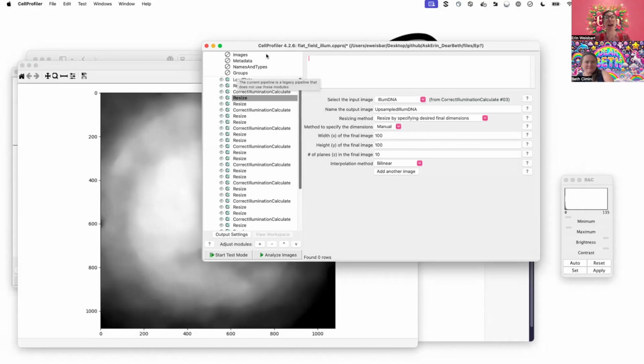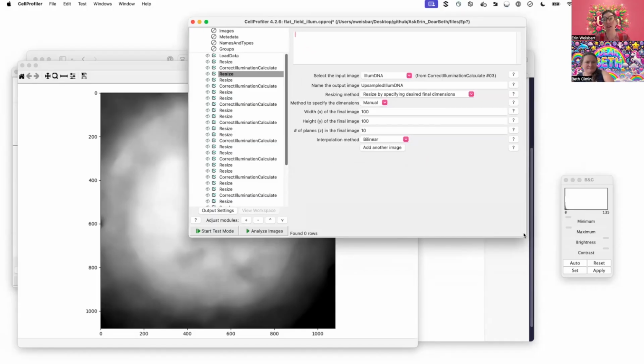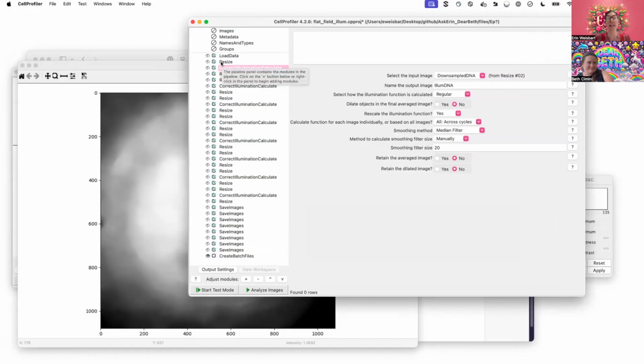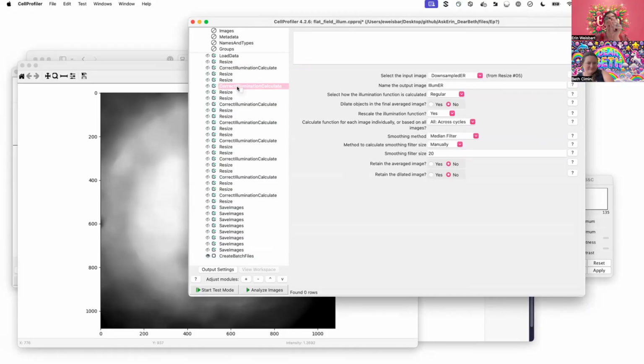approach. And this pipeline is our standard high content pipeline that we use in all of our big high content Cell Painting screens. And you see here, I have this resize down, Illum calculate, resize back up for each of the different channels. So it goes to DNA, ER, RNA. So within this same pipeline, I'm making Illum correction files for each channel. If I really want to distribute this, I could run a different pipeline for each channel.